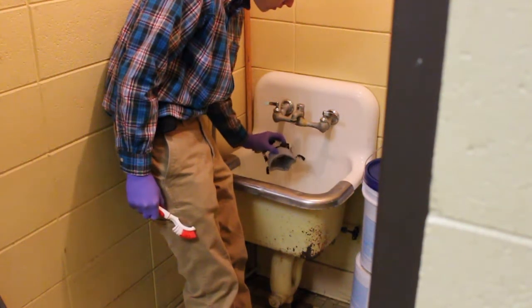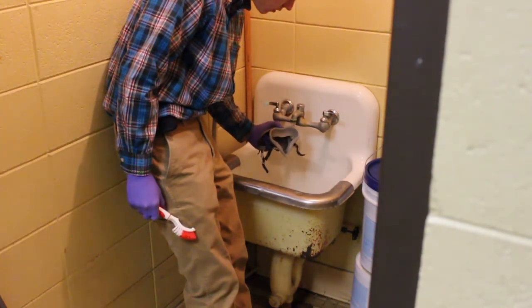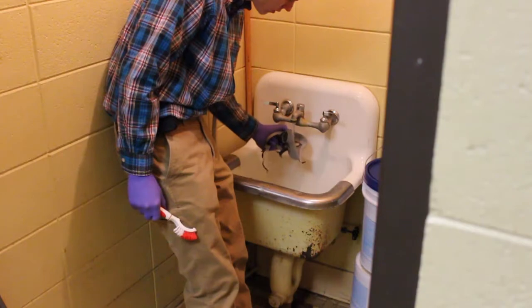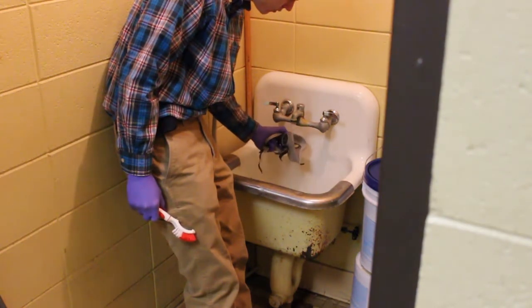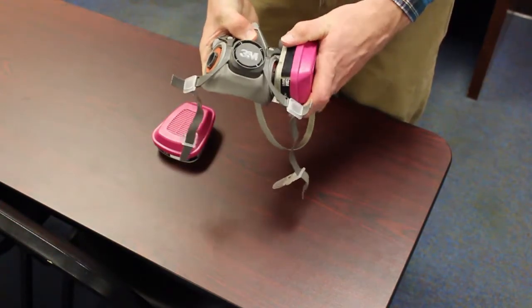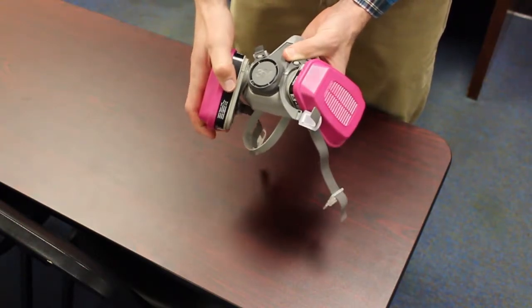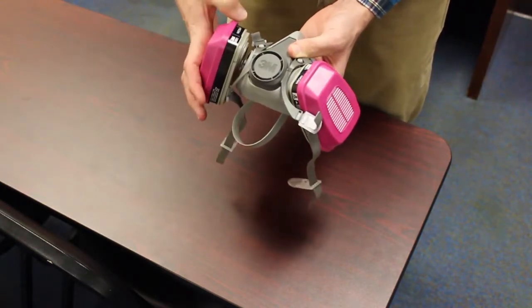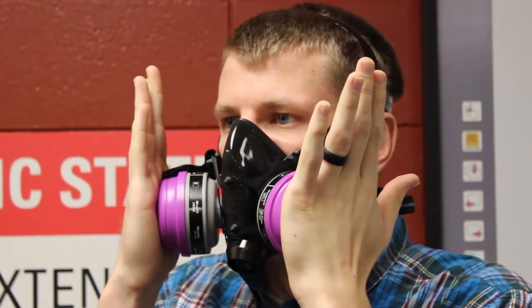Detergents or disinfectants that dry on face pieces may result in dermatitis. In addition, some disinfectants may cause deterioration of rubber or corrosion of metal parts if not completely removed. Components should be hand-dried with a clean lint-free cloth or air-dried. Reassemble the face piece, replacing filters, cartridges, and canisters where necessary. Then test the respirator to ensure that all components are working properly.